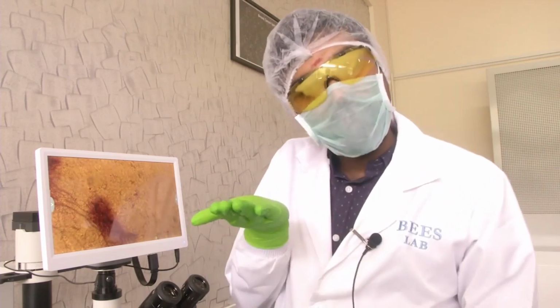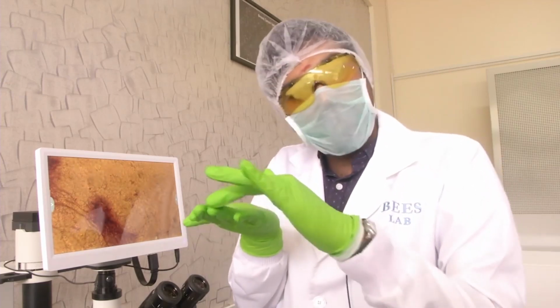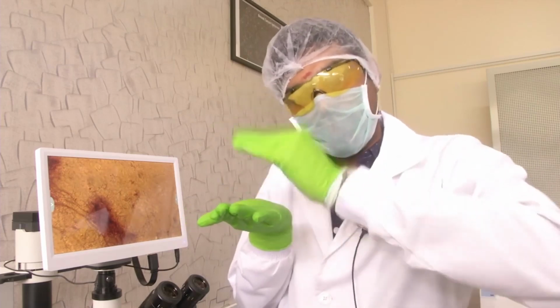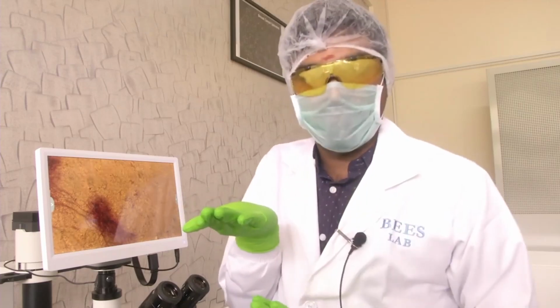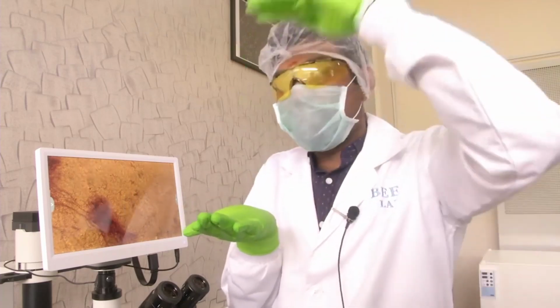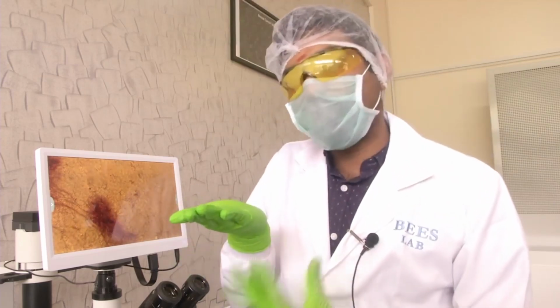But let us say you image from the bottom. When you image from the bottom, what happens? Already the cell is spread out like this with a spherical surface on top. But if you image from the bottom, you can actually see the interface itself, which you cannot get when you are imaging from the top. That is why we are going for an inverted microscope.